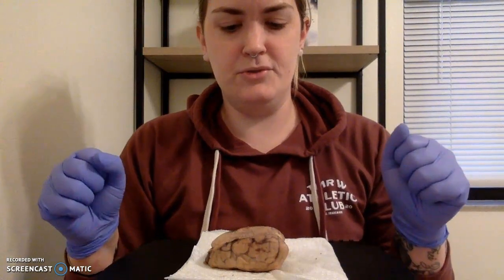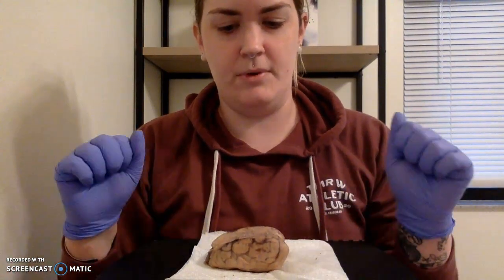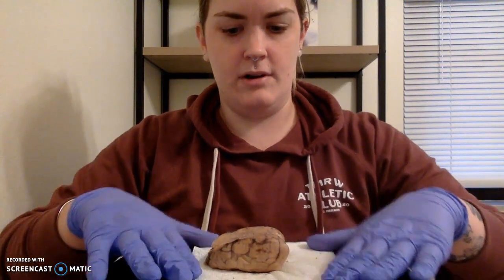So first things first, I will say this is a little bit dramatic just because my hands are shaking so bad. I don't know why. I realize nothing I can do can hurt this sheep, but whew. Okay, so let's get started.